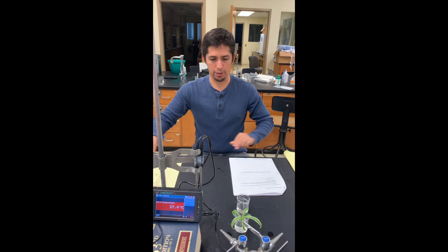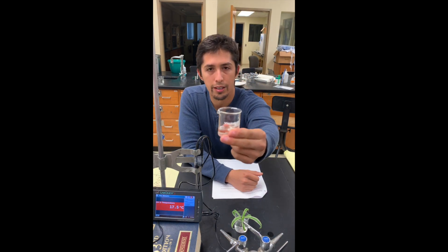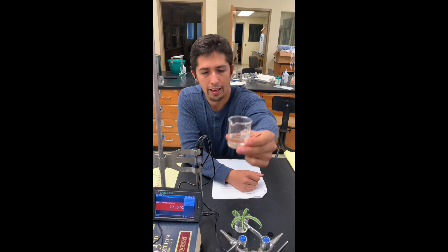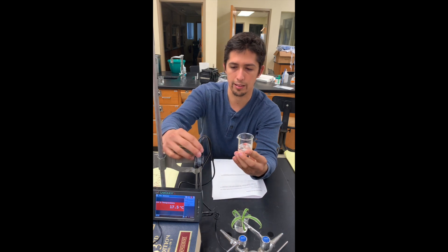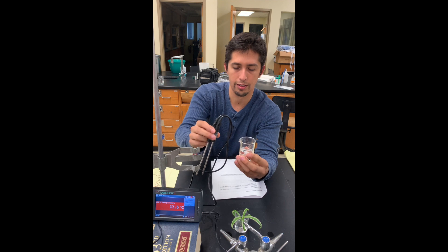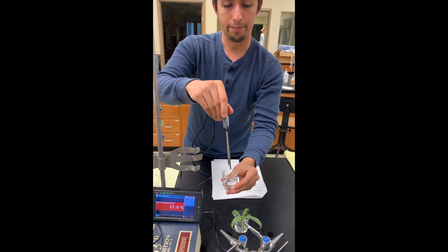For this demonstration, I will go ahead and have a small beaker containing acetone as you can see there. I will be taking this temperature probe and putting it into the beaker, measuring its initial temperature, so I will go ahead and do that now.